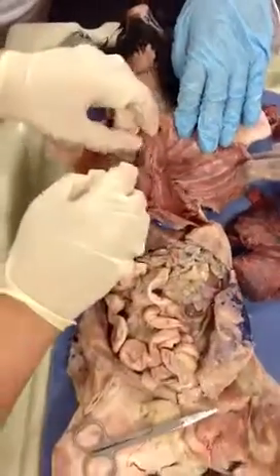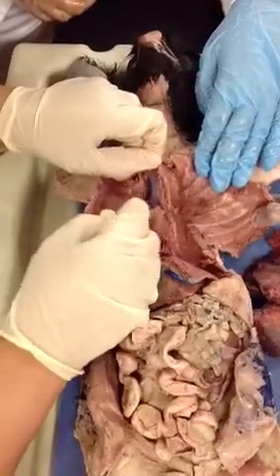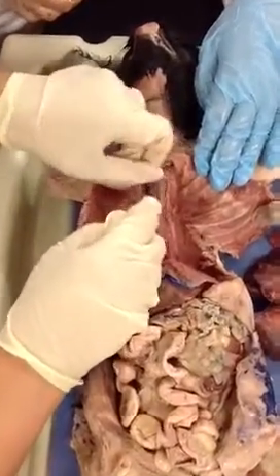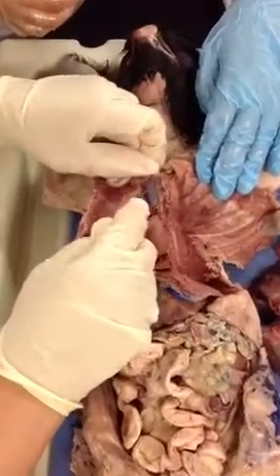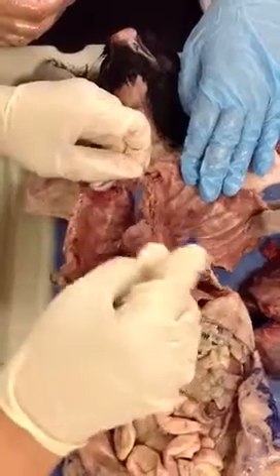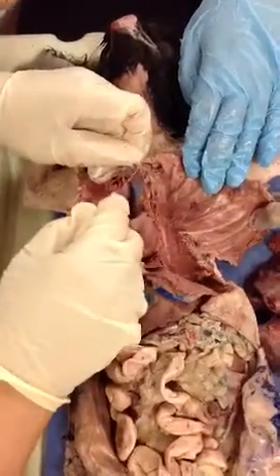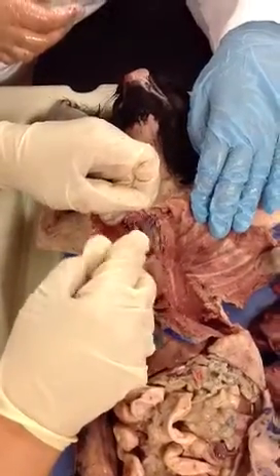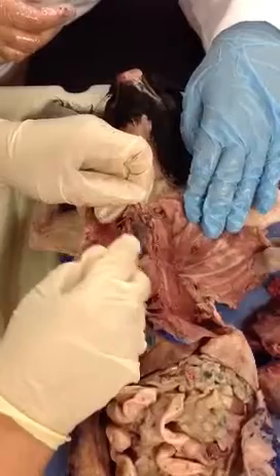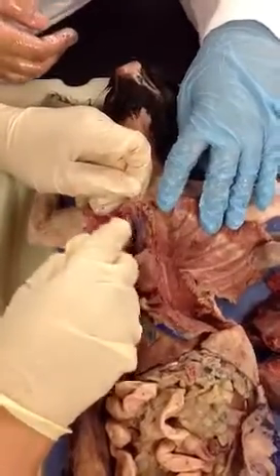Very good. Now, let's proceed with the branches of the brachiocephalic artery in the cat. Which ones are they, please? Look it up in your book. Right subclavian. Go on, please. The middle one is the common... Right and left subclavian. Right and left common carotid. Very good. So right and left common carotids.